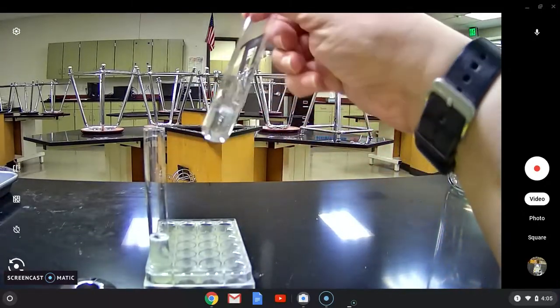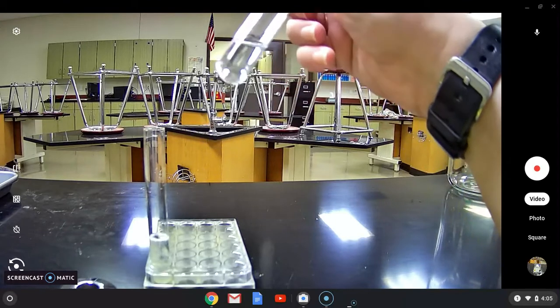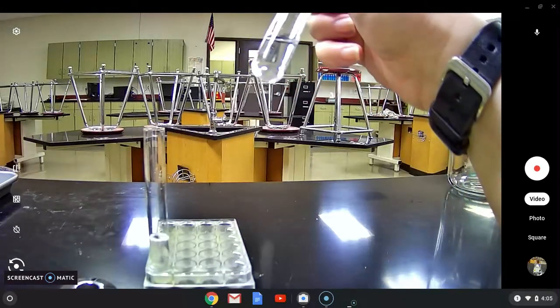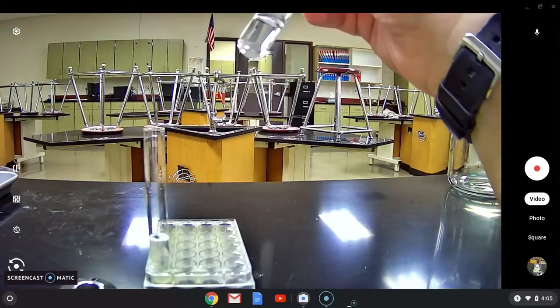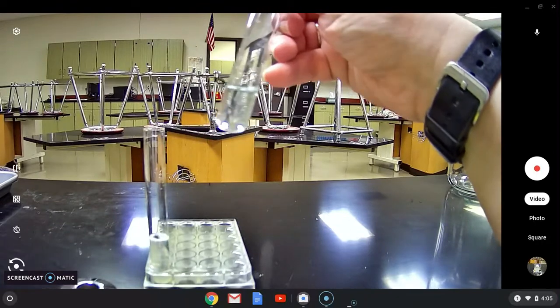Okay so in the plain water the pale blue has shifted so that it's all throughout and you don't really see much color anymore.